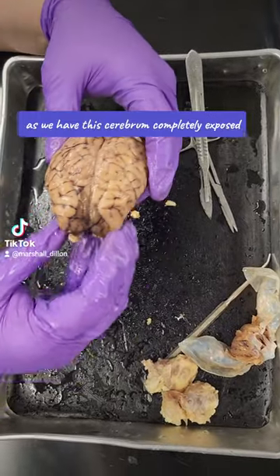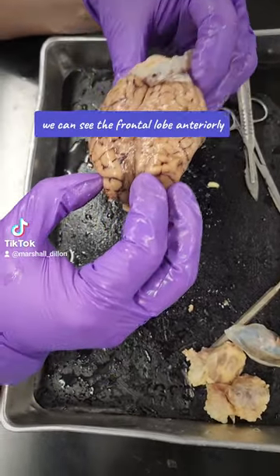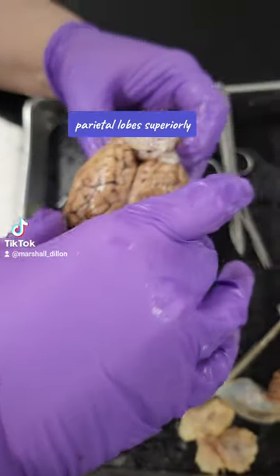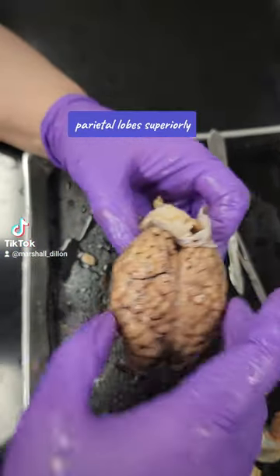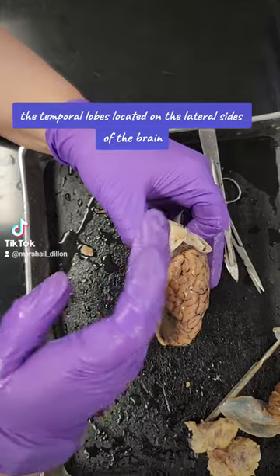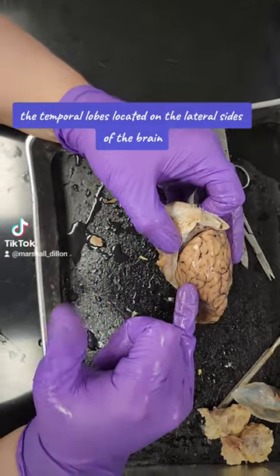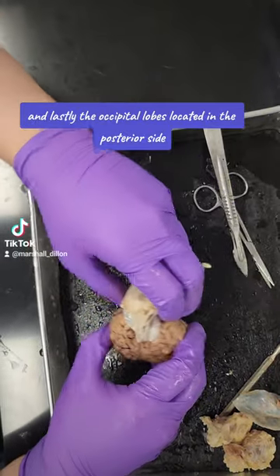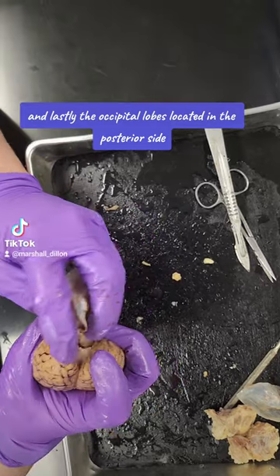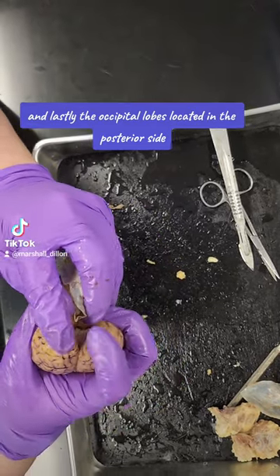As we have the cerebrum completely exposed, we can see the frontal lobe anteriorly, parietal lobe superiorly, the temporal lobes located on the lateral sides of the brain, and lastly the occipital lobes located on the posterior side.